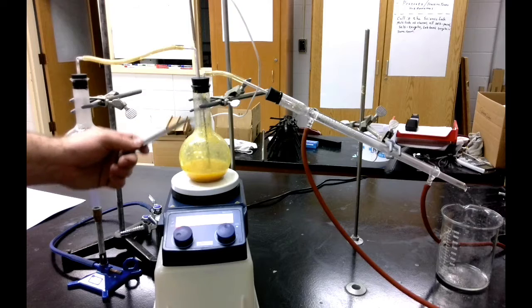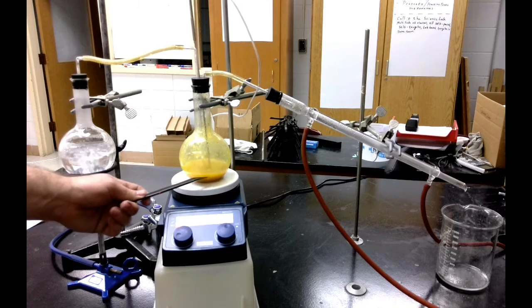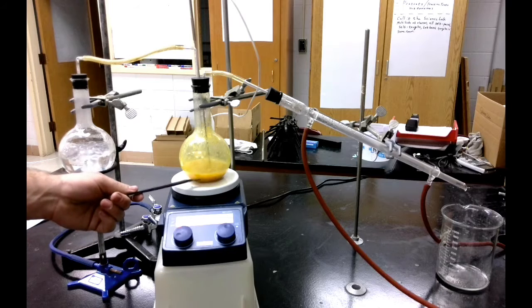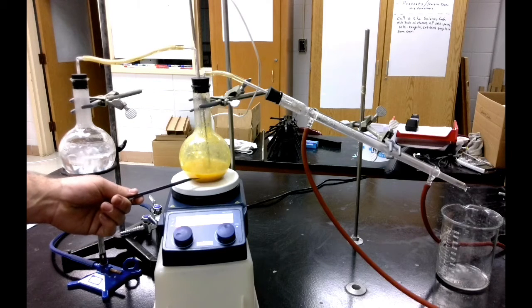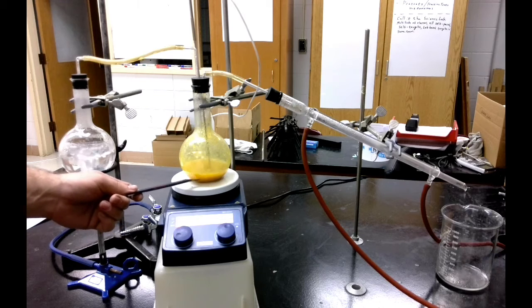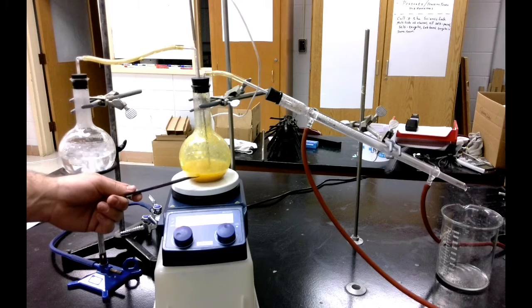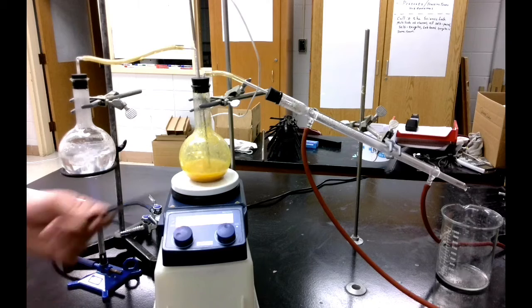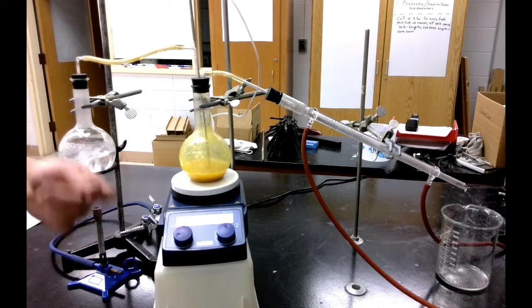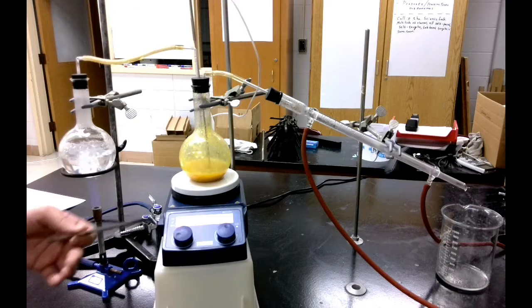Once I've got the steam traveling down into this fluid, which is just a solution of water and the orange zest that we're distilling, as it travels through here, it heats up the limonene, which is the aroma responsible for the smell of oranges and lemons. That's the molecule that we're trying to extract. That's our smelly chemical that we're trying to get out of this.